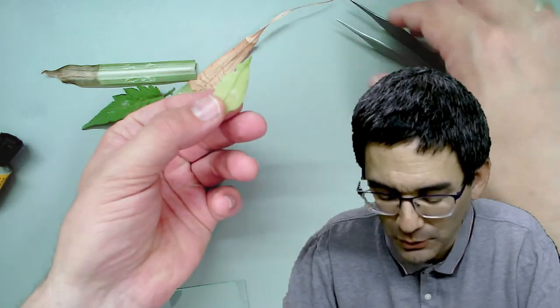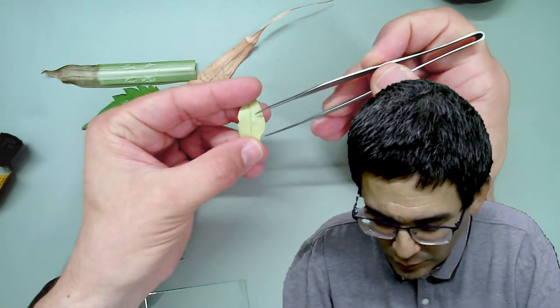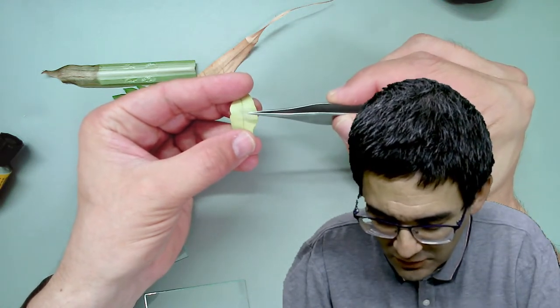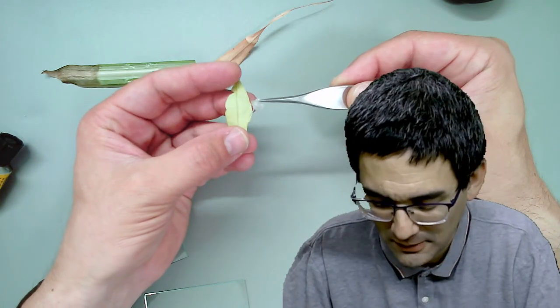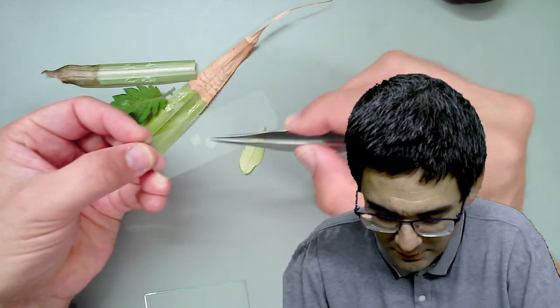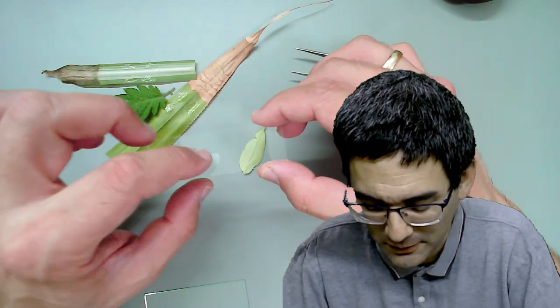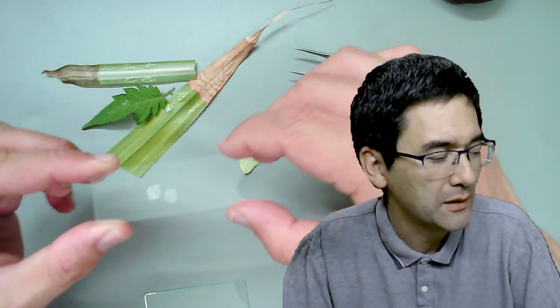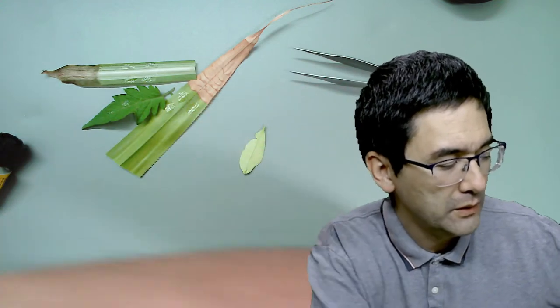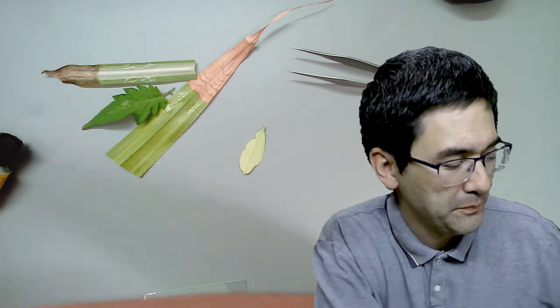There are two tiny spots of glue here - let me try to peel it off. You have to let it dry reasonably well. It went off very nicely - here it is. Let's put this under the microscope. I got both off; I haven't tried this one yet, so it's going to be a bit of a surprise.